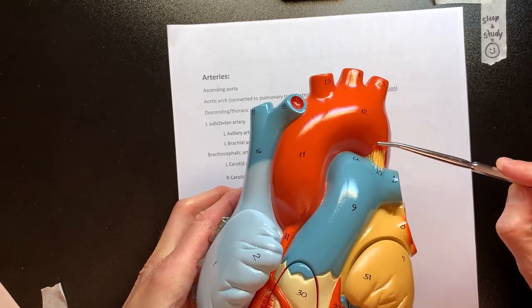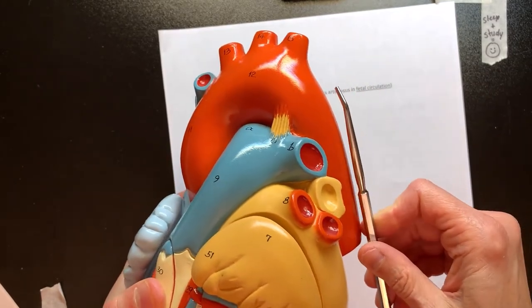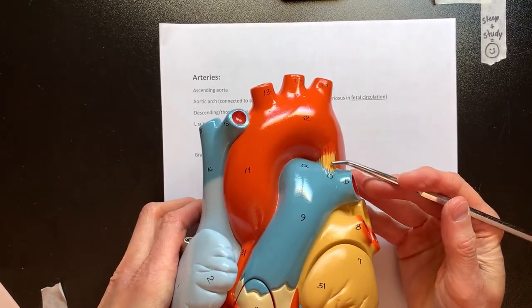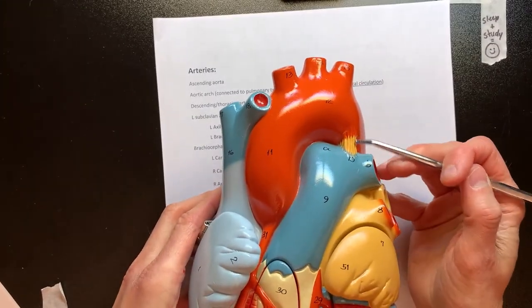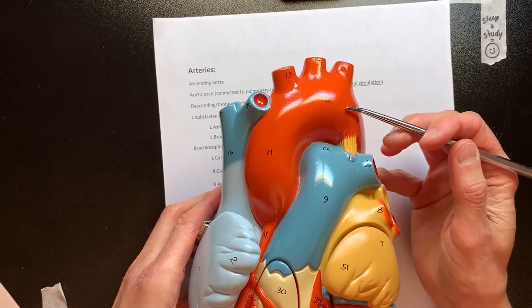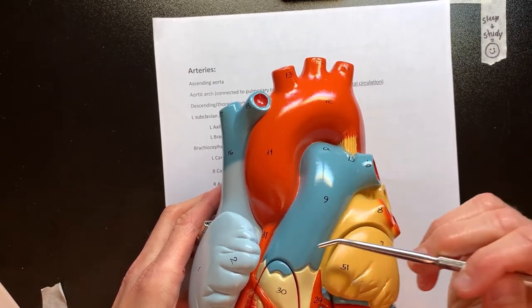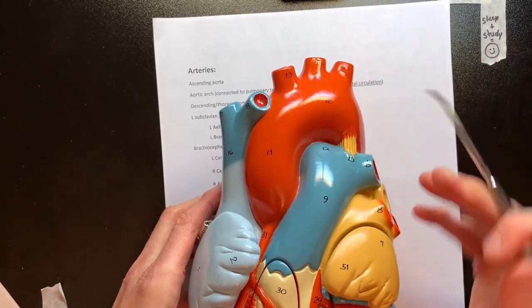So we've got the ascending aorta, the aortic arch, and then the descending going down the back — what we consider the thoracic aorta. There's the ductus arteriosus, or in an adult heart, the ligamentum arteriosus. This is where the connection would be between the fetal pulmonary trunk and the fetal aorta. Remember this is not the aorta — when you're looking at the pig it will look like it, but just go behind it and you'll see the aorta.